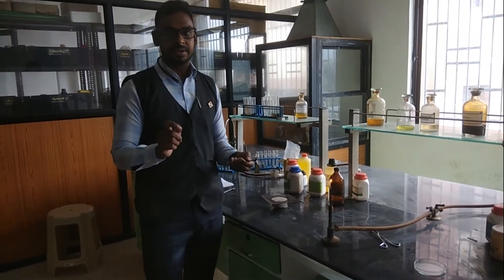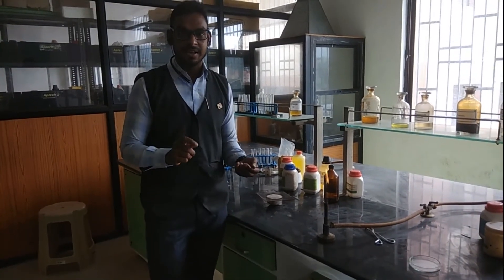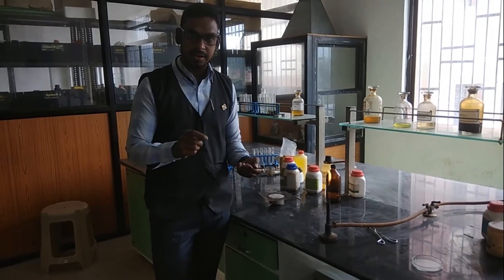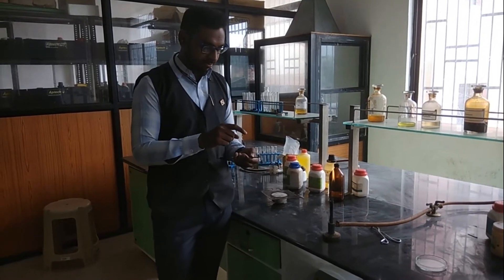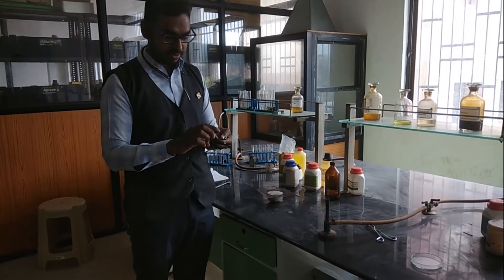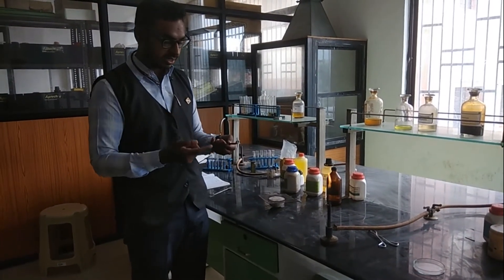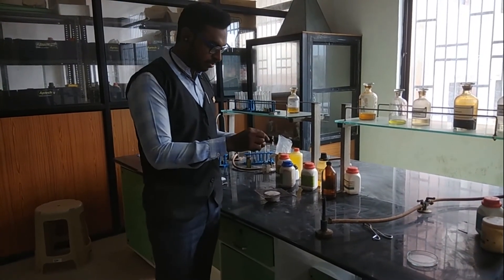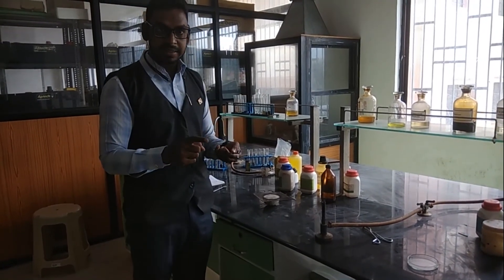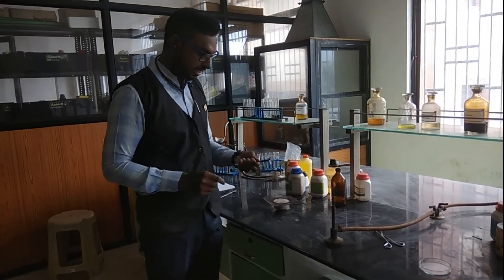The element detection test is also called the Lassaigne test. The Lassaigne test covers the test for nitrogen, test for sulfur, and test for halogen. First, we take a test tube. Sodium metal is added to the test tube, and then the liquid compound is added and heated.